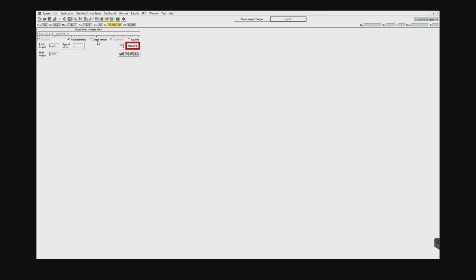Now how often should you run these samples? It really depends on the lab that you're in and the guidelines that you are using in the lab. Some labs are very rigorous. They have to run their check samples every batch, and some do it every day, twice a day. So that's really up to you. Otherwise, it's arbitrary if I just told you once a week. So go ahead and set a check sample here, and go ahead and measure it.